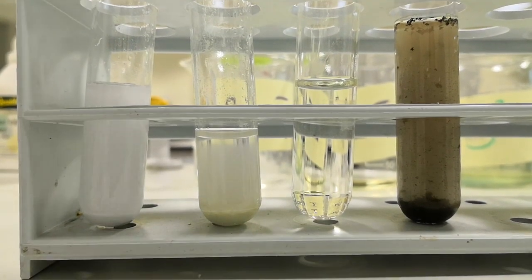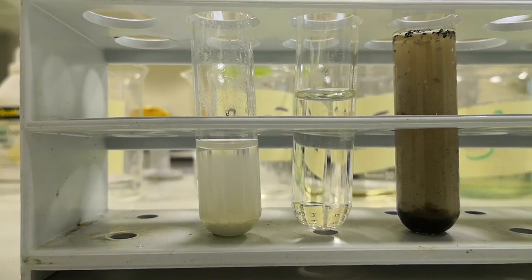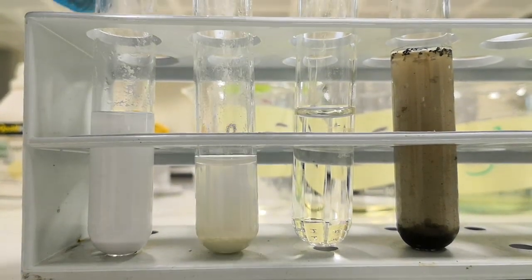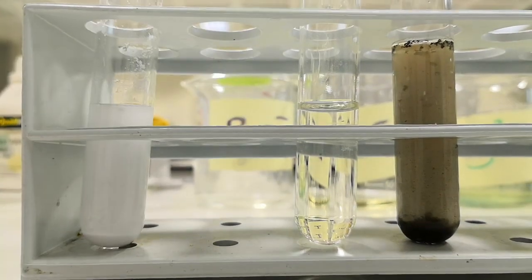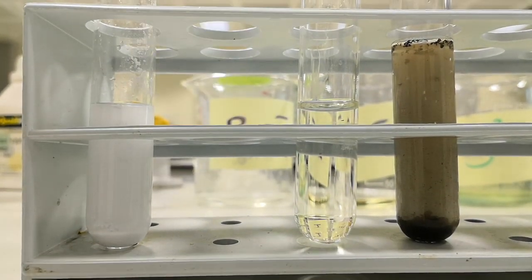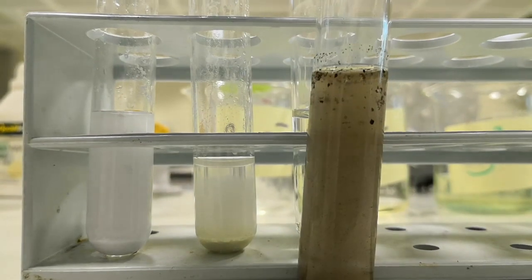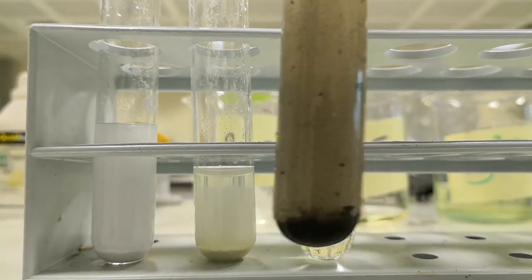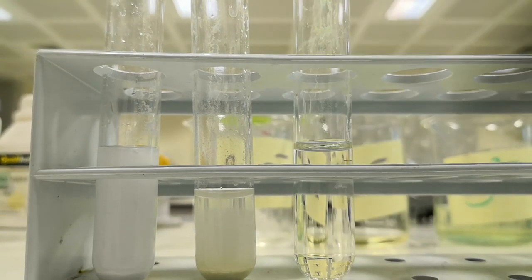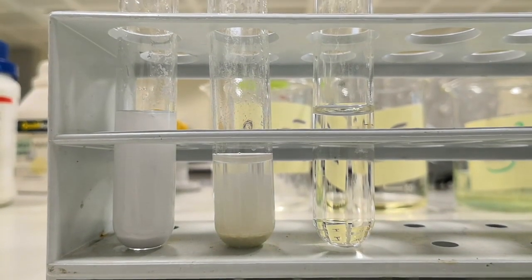Before we finish this experiment, as you can see here: the white precipitate indicates the presence of chloride ion. For the other test tube, a creamy white precipitate deposited at the bottom indicates the presence of bromide ion. Here, this was a black precipitate, but as mentioned, it takes some time — and this black precipitate will disappear when HCl is added. As you can see here, it has started to disappear, but of course it takes some time.